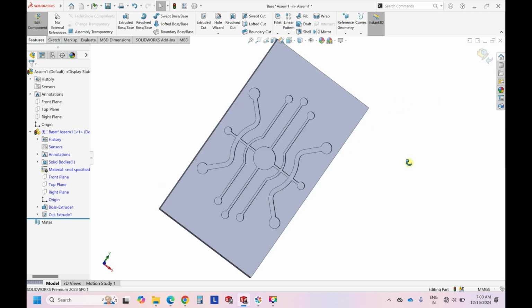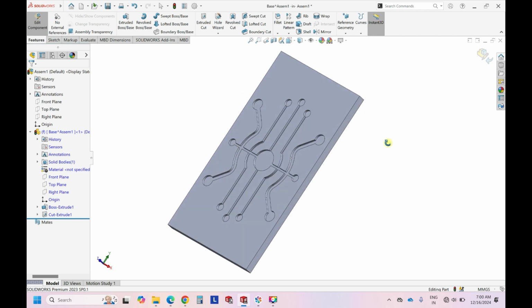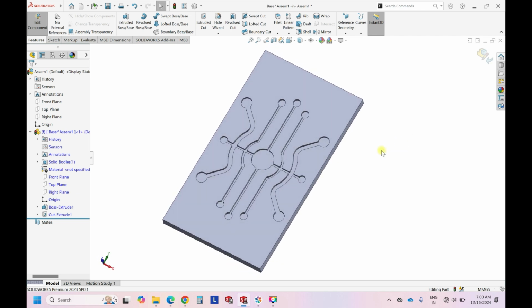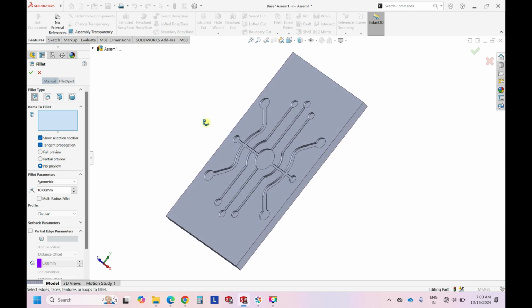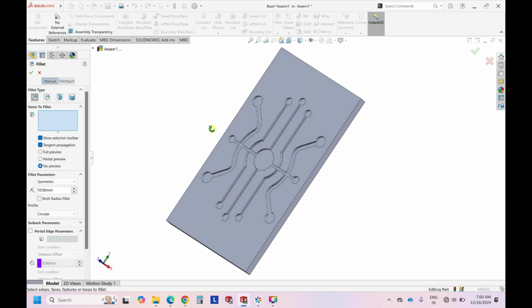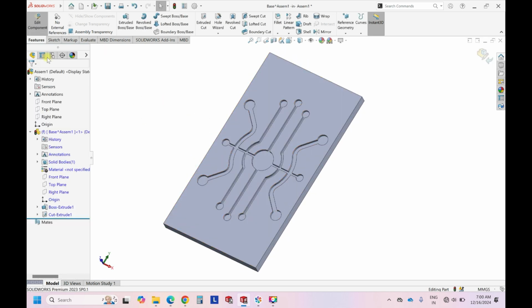Okay, so once it is done, this is how the chip looks. Then you can use some features, fillets, on the circle portions like this. But we can do this later or now. I just wanted to do the channels and the outlets first, and then we can do the filleting. That is easier.